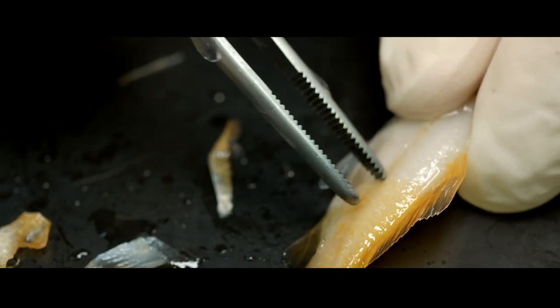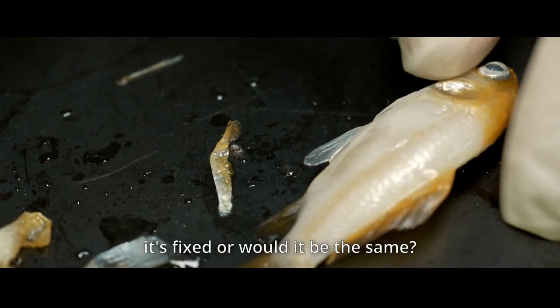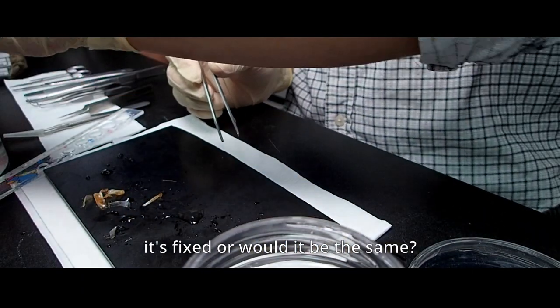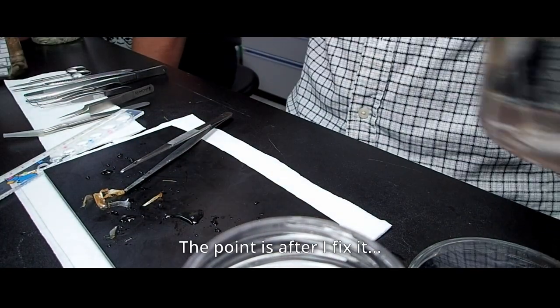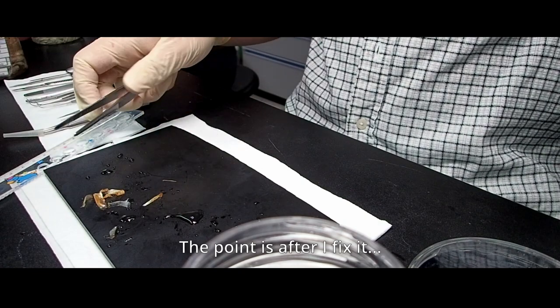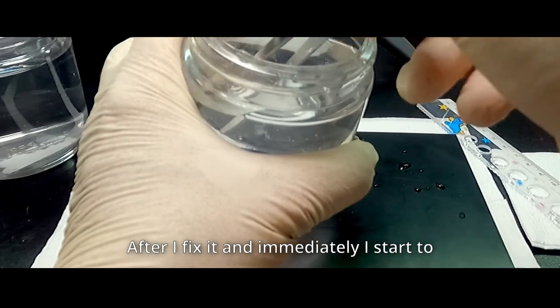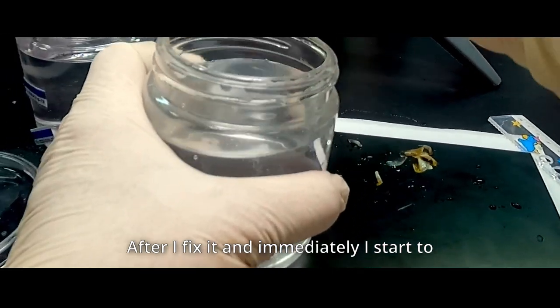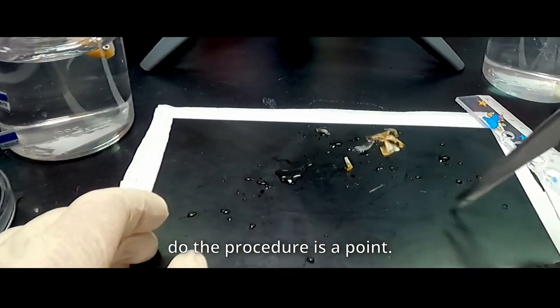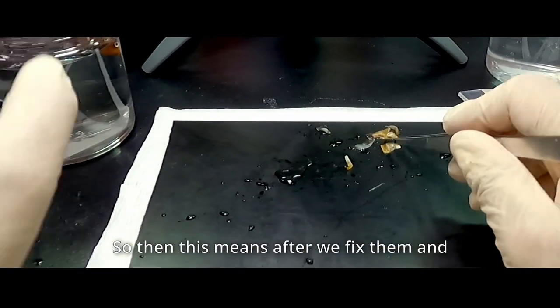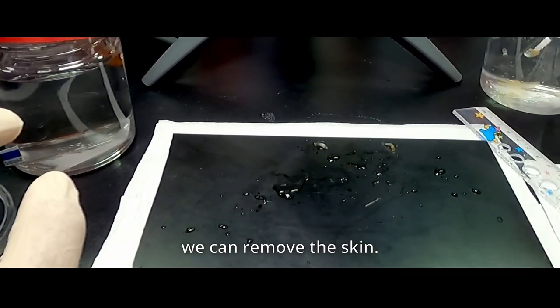And basically, procedure is the same. And here, really must be careful. Is it because it's fixed, or would it be the same? It's a good question. The point is, after I fix it, and immediately I start to do the procedure. It's a point. So then, this means after we fix them, we can remove the skin.